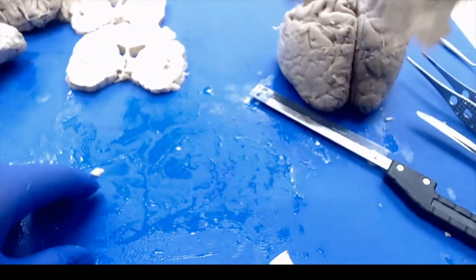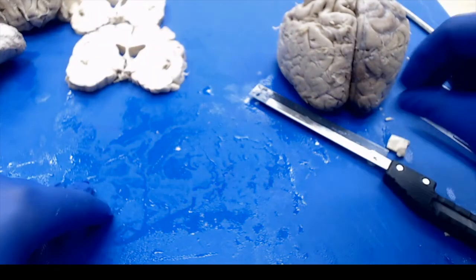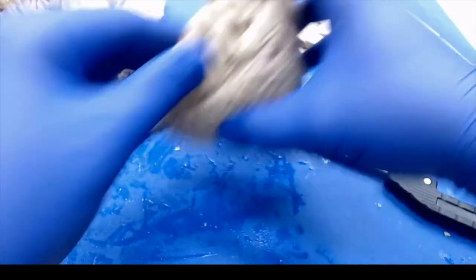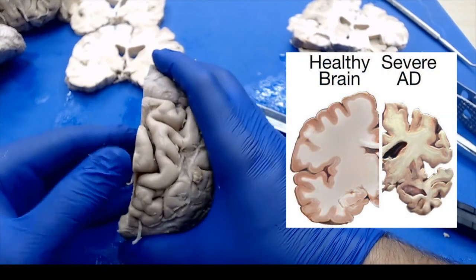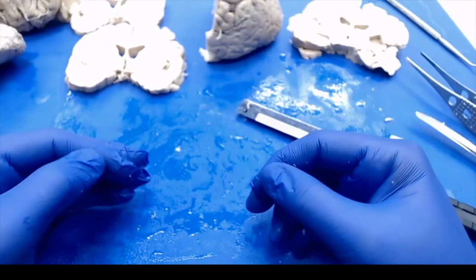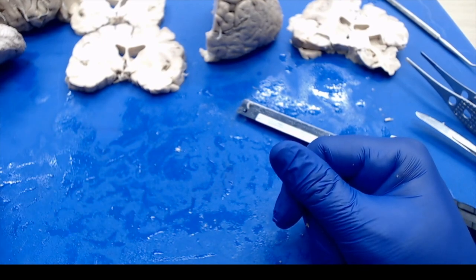Some of the things you'd be able to notice at this point too in your dissection, patients with neurodegenerative disorders will have really prominent sulci and really narrowed gyri. Particularly in Alzheimer's cases, you'll see stuff like that. And so taking samples of your cerebrum in the periphery there will actually help diagnose those particular conditions.